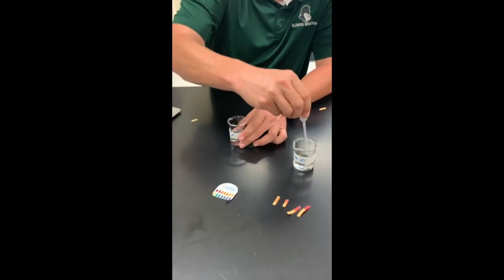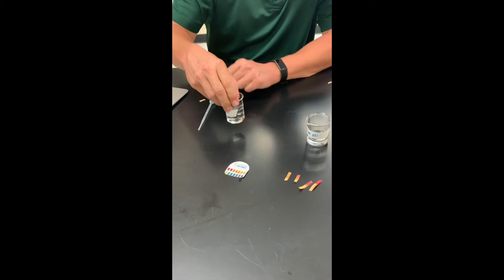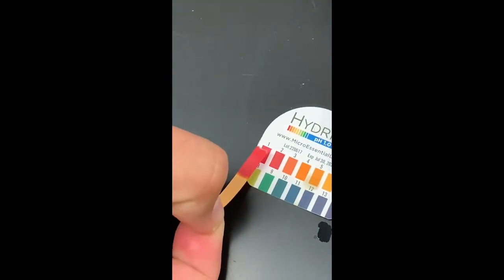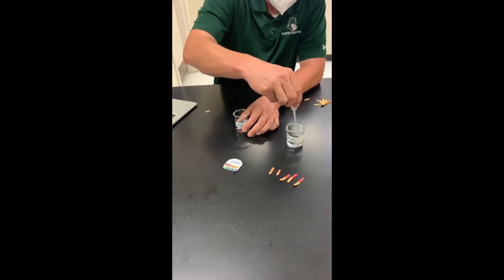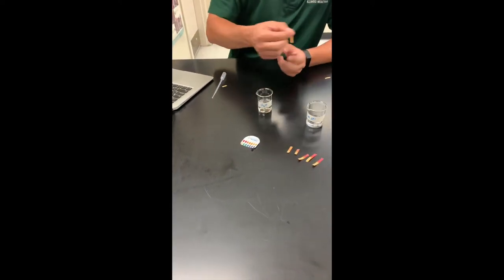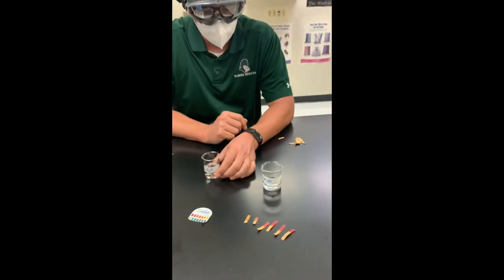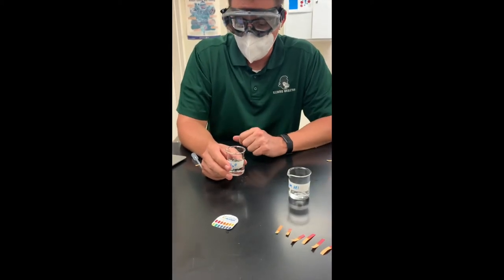This will be our fourth milliliter — swirl it up and take the pH. And that's definitely a one now. And then our last milliliter — added, swirled, check — still at a one. So that's our second test, testing the effects of hydrochloric acid, adding one milliliter of 0.1 molar hydrochloric acid at a time to water to see what happens to the pH of our water.